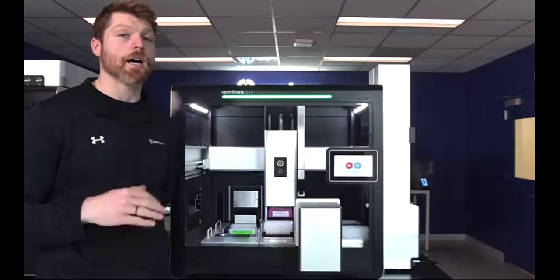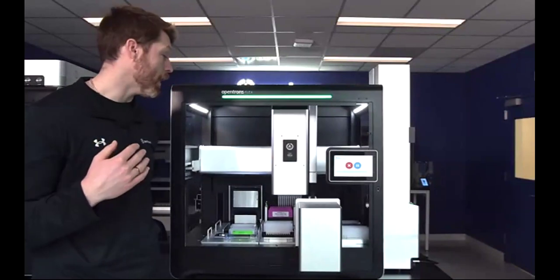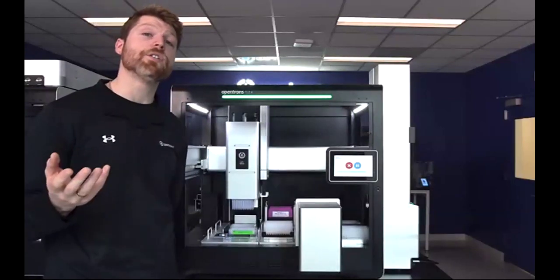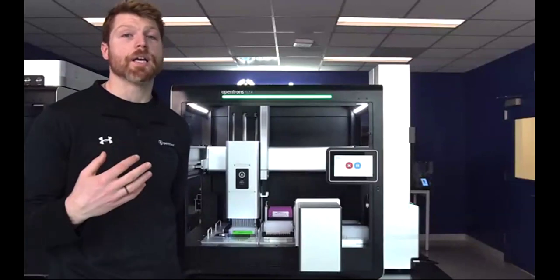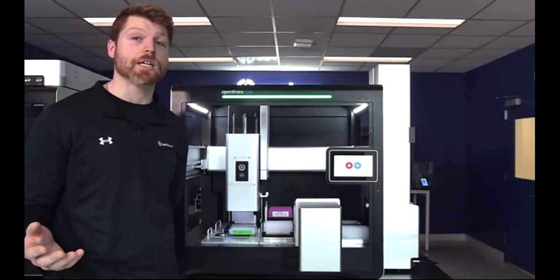The stackers have the ability, as I had mentioned previously, to house either tips or different types of labware as well. And so they not only have the ability to bring labware to the deck, but also to store that labware. So if you have multiple stackers, up to 4 in a protocol, you have the ability to bring plates out and then also store them into a different stacker. You have the same ability with different tip racks. So if you wanted to save those for future runs, you have the ability to just place them back into a stacker and continue running in that way.